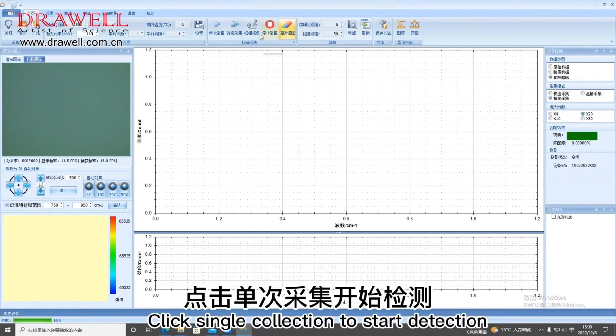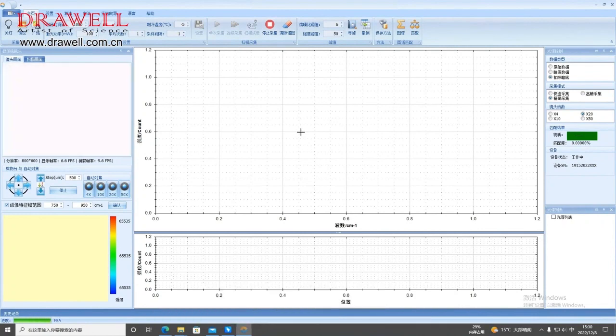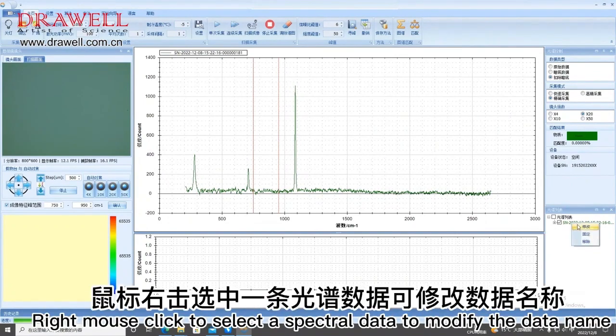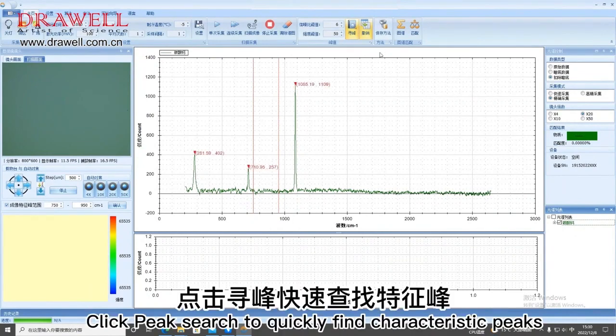Click single collection to start detection. Completion of collection. The list of spectra collected can be viewed in the lower right corner. Right mouse click to select a spectral data to modify the data name. Click Peak Search to quickly find characteristic peaks.